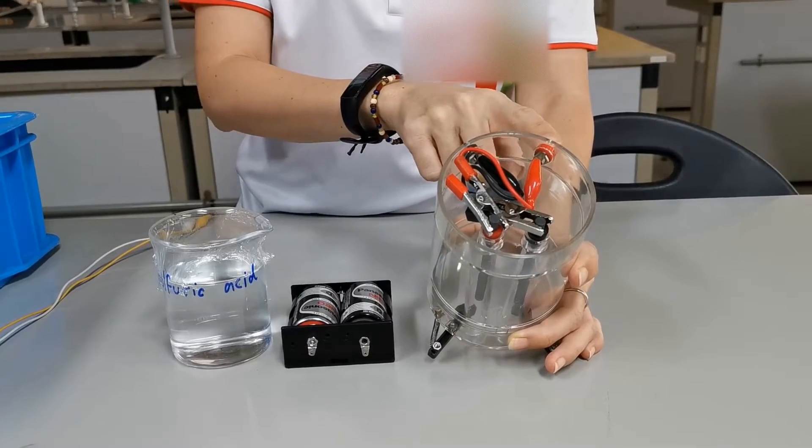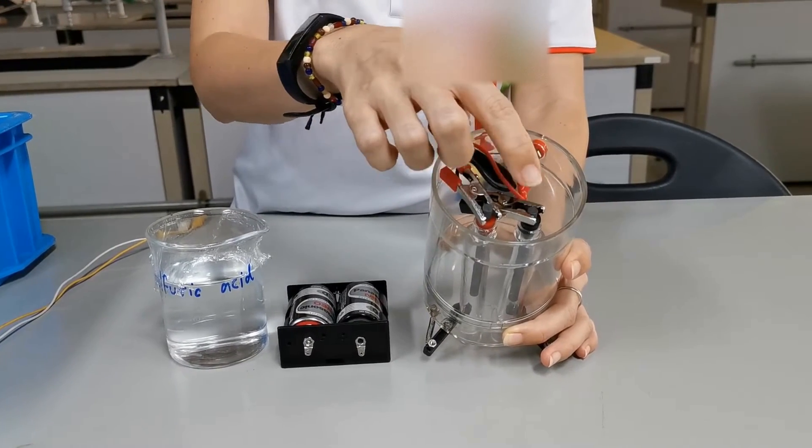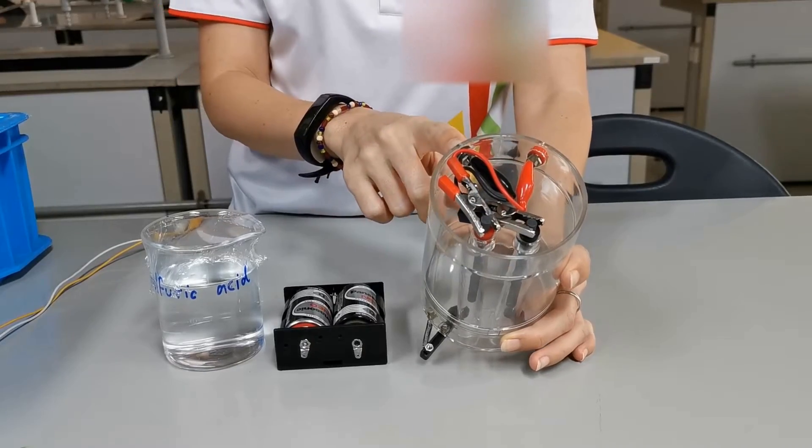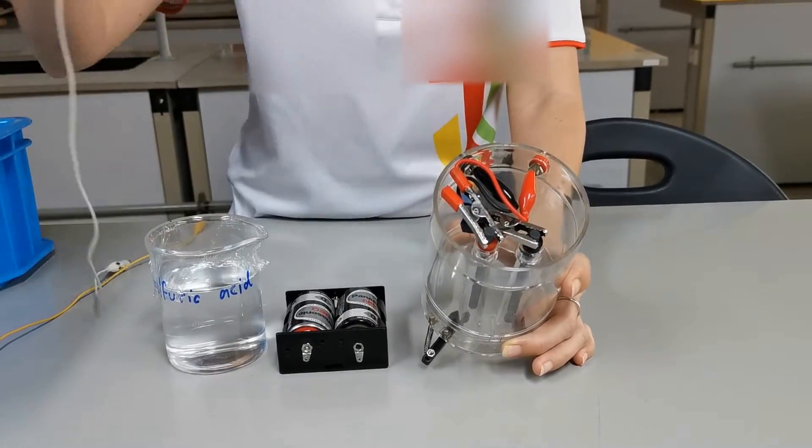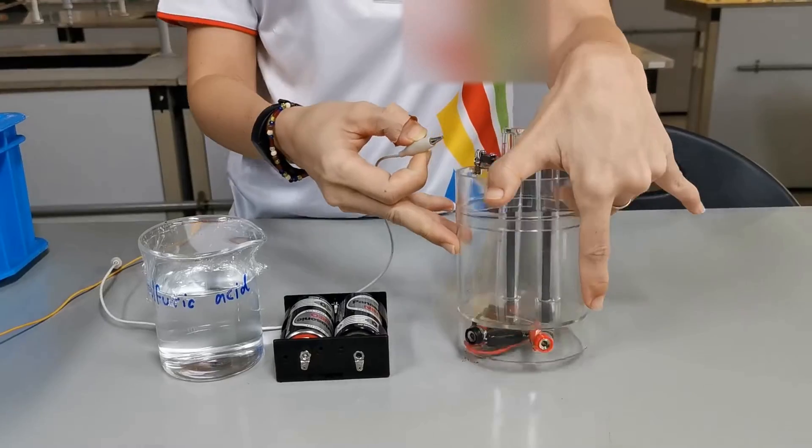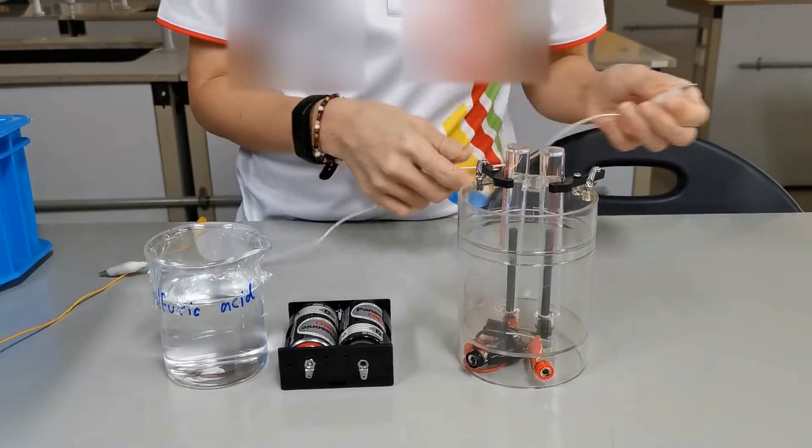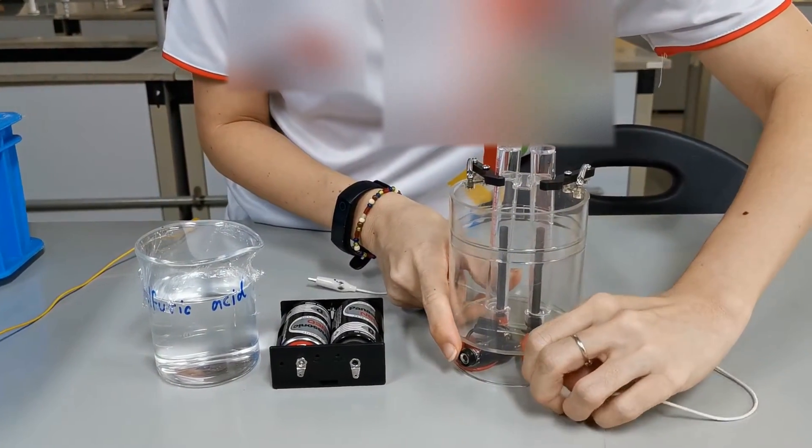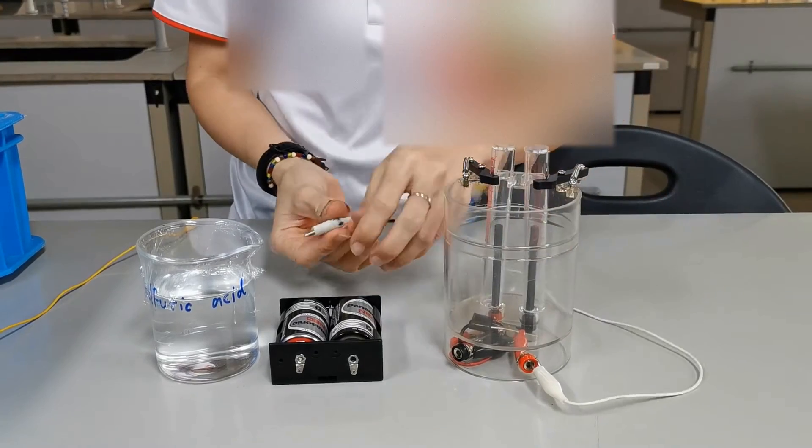And another carbon electrode connected to the other metal piece, and these metal pieces will then be connected to our battery as the source of power.